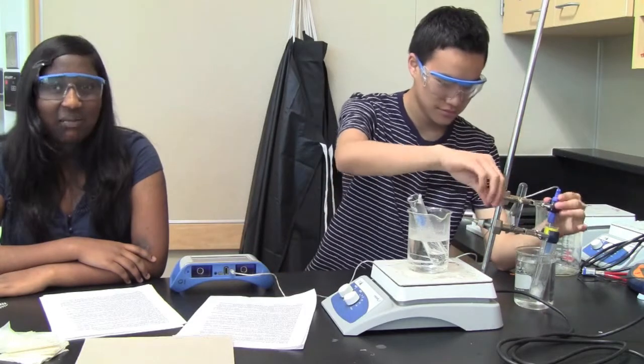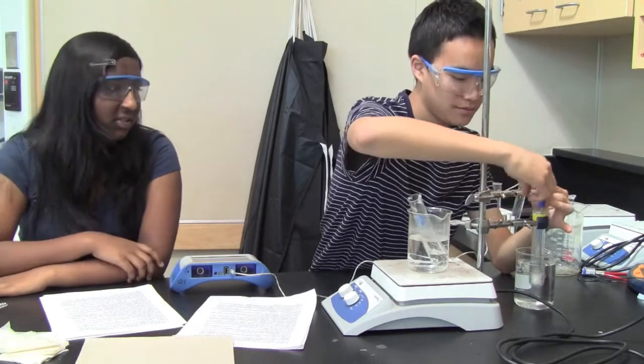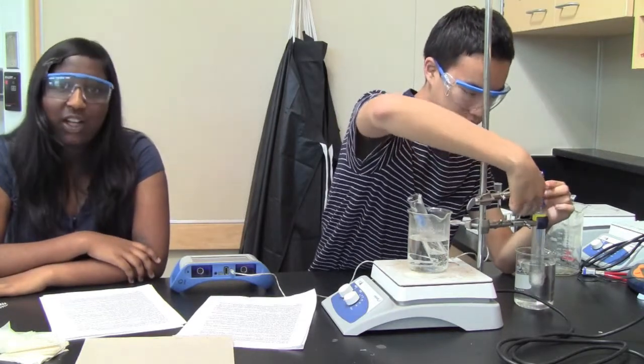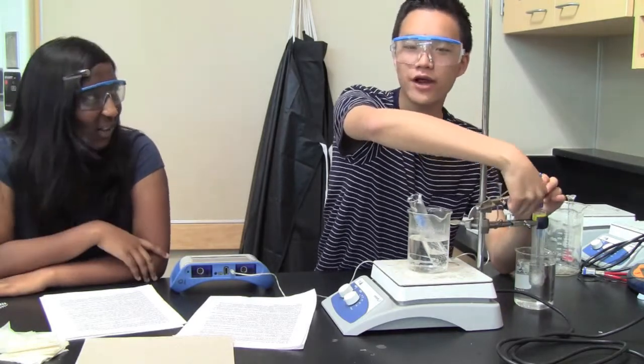So now we have finished making this a solid solution. You want to make sure it's solid. If it's not solid, then you're wasting your data and time. And again, you might have to stay in at break and ruin your day. Really, it's not fun. You could be doing things with your life, like studying for AP Calc or something.